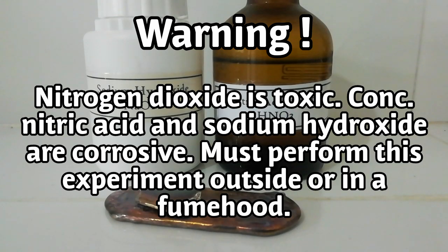Nitrogen dioxide is toxic. Concentrated nitric acid and sodium hydroxide are corrosive. Must perform this experiment outside or in a fume hood.